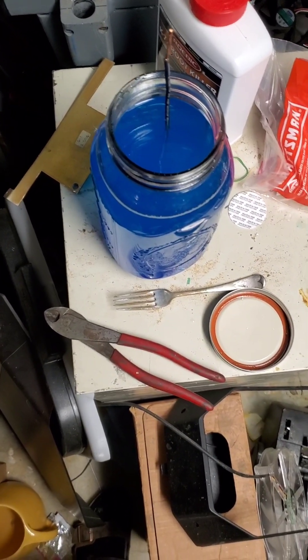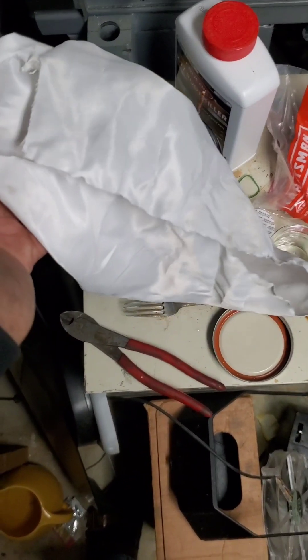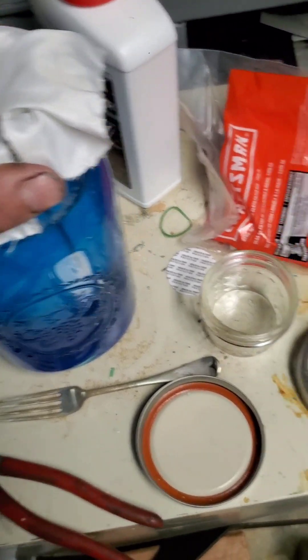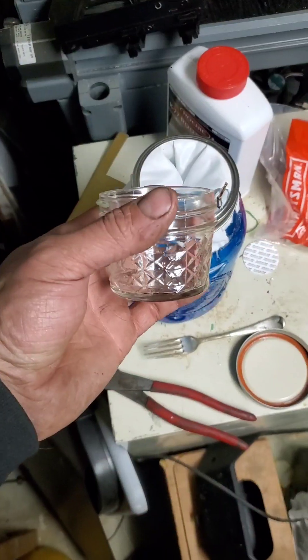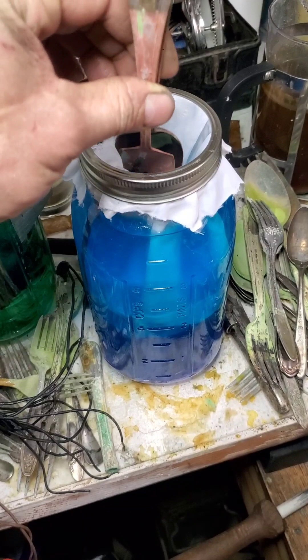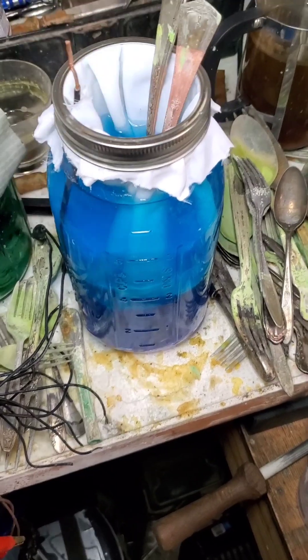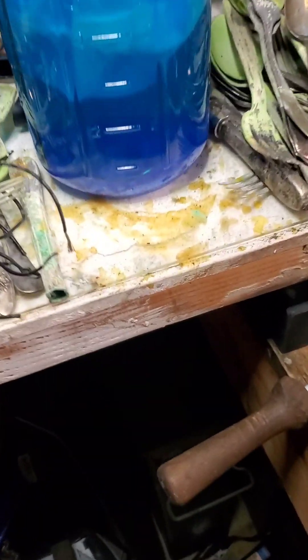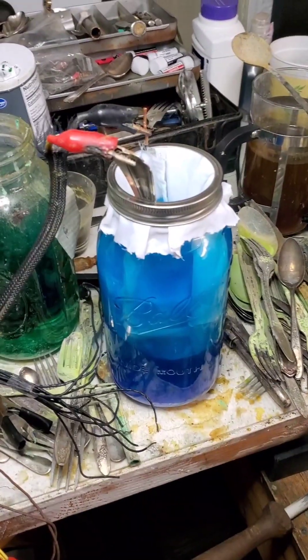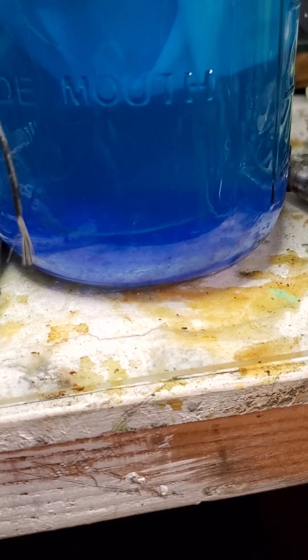I made this filter basket here. I just took and cut the rubber ring off, and then there's a little notch in it for the wire to come out of for when I need to set up the anode. I got my filter bag on the top there, and I'll just use the ring to secure it to the jar. This little jar going in the bottom will act as a collector. I'm going to start with a couple of copper pieces before doing brass, because the idea is ultimately I can use this to refine the brass out. Got my anode down there and we'll put 12 volts on it. There's the collector and some of the undissolved copper sulfate — that'll dissolve eventually.